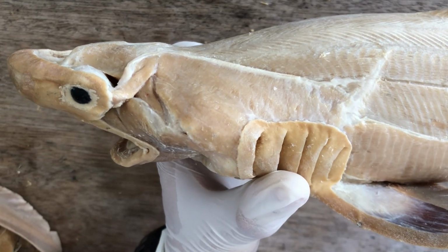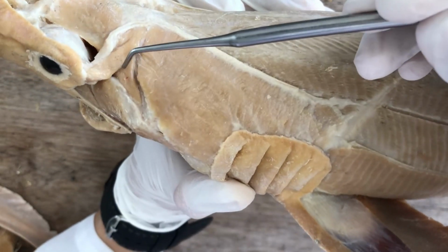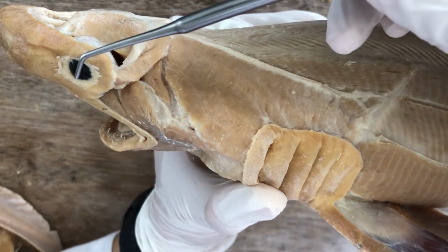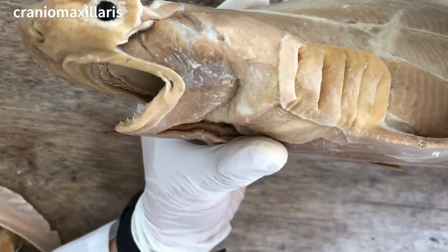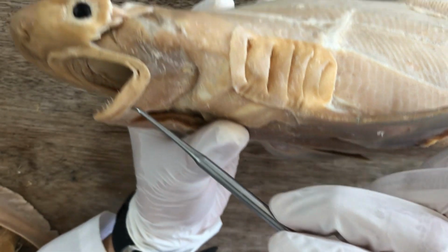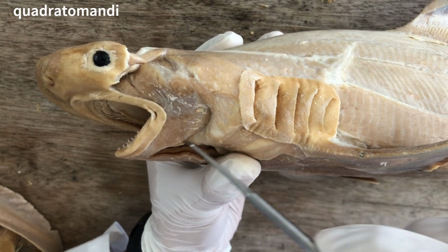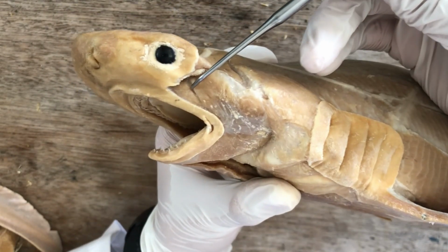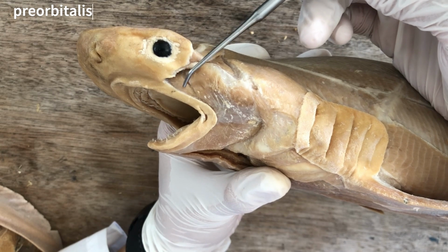So the first dorsal constrictors are the following. This muscle here, located at the back of the eye, is the craniomaxillaris, and then located at the angle of the jaw, this large muscle at the angle of the jaw, that's the quadratomandibularis. And then it has a smaller sibling anterior to it, that's the preorbitalis.